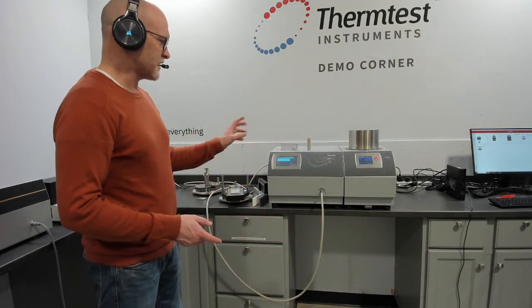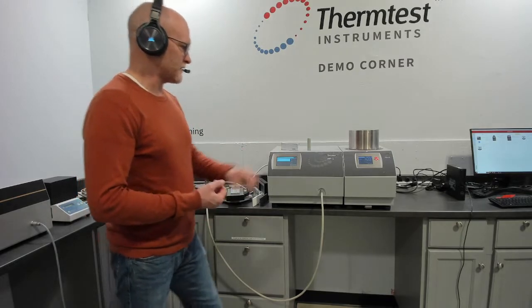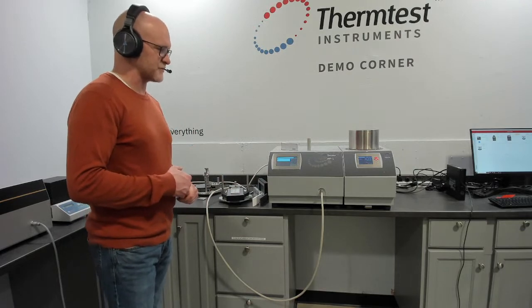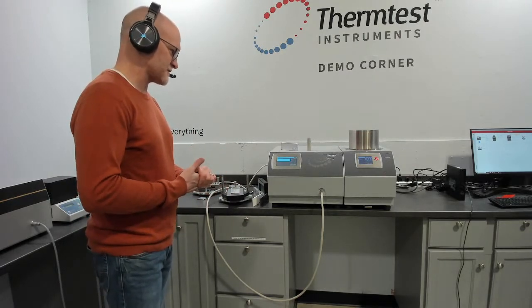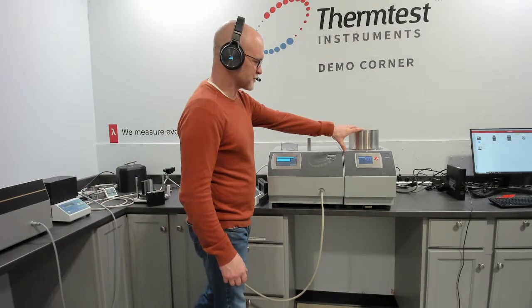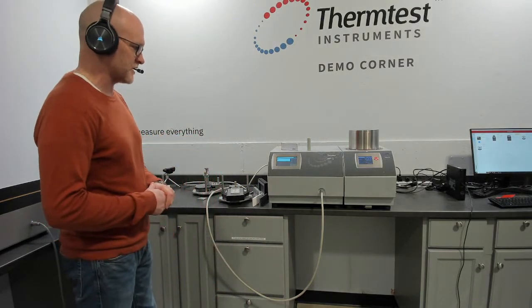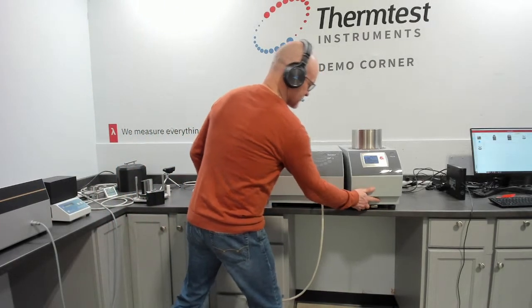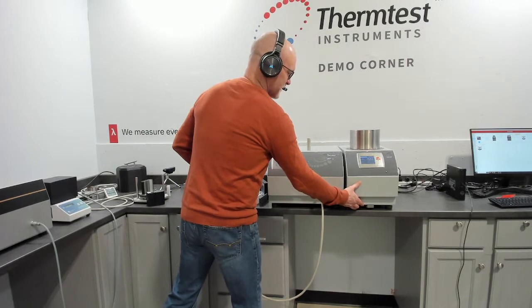The other methods that you can combine with the MP-1 are transient hot wire. There's a matching temperature platform for that, again for measuring liquids and phase change materials, transient line source, and transient hot strip. But if you don't need this particular temperature platform, or if you need an oven, one of the other ovens we offer that you can communicate with the MP-1, you can certainly acquire just the controller by itself. But you can expand this unit.